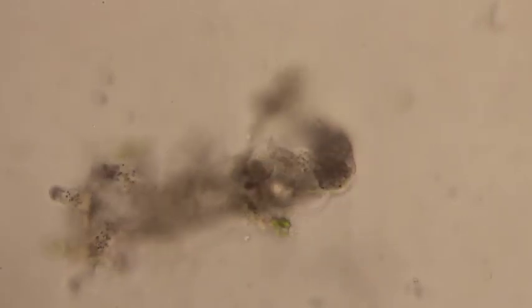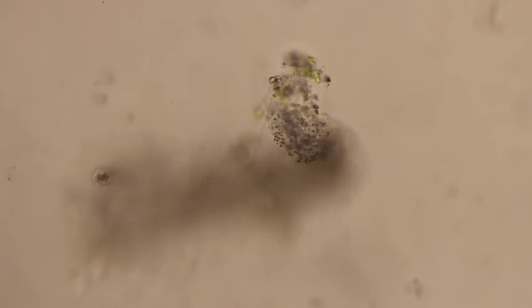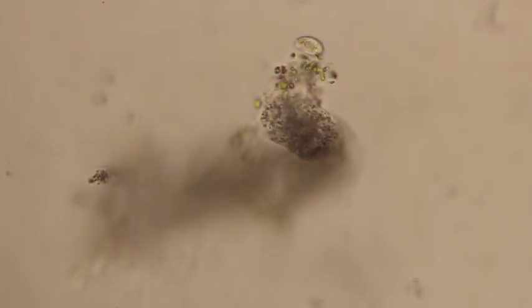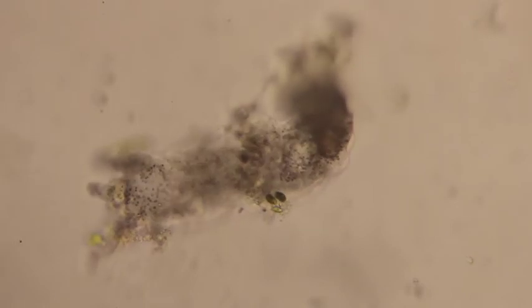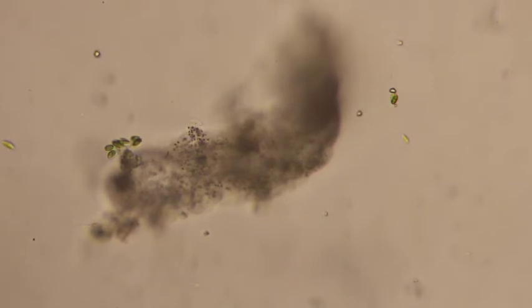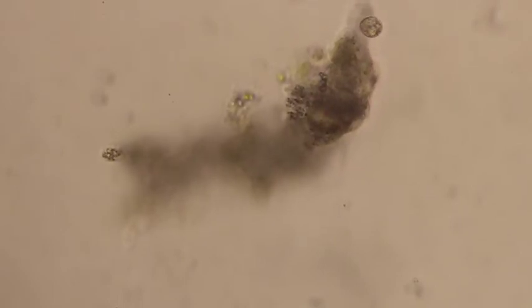Okay, and I'll just let you view this amoeba here as it's moving out. You can see that nice euglena swimming around at the top of that layer. That amoeba is definitely attaching its pseudopodium on that layer there. We can move down and about and see. It's interesting because it obviously didn't like this little greenery to the left. So the back left, it left that. It decided not to eat that at all. And instead, it looks like it's pursuing that euglena right there. See that euglena right at the tip that it seems to be trying to grab.